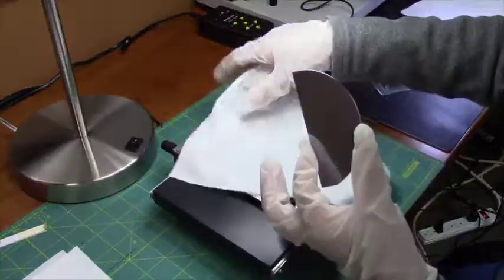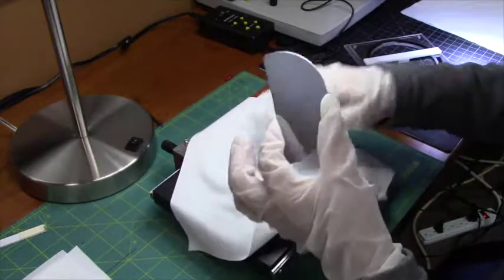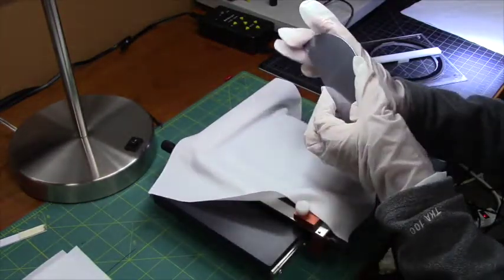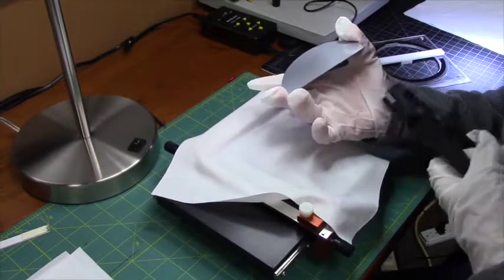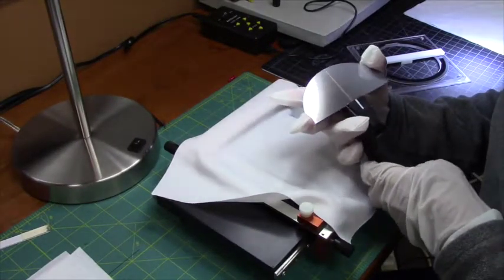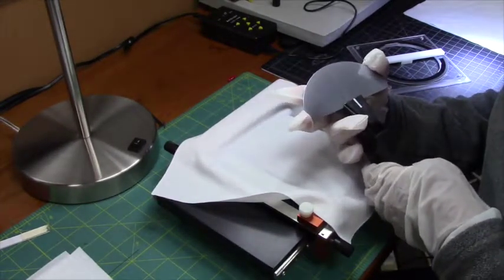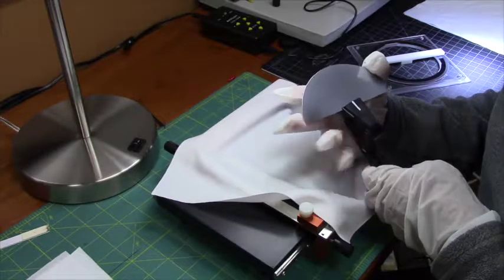Again, put a clean room cloth here. And now I am going to cleave this in half using my cleaving pliers once again.